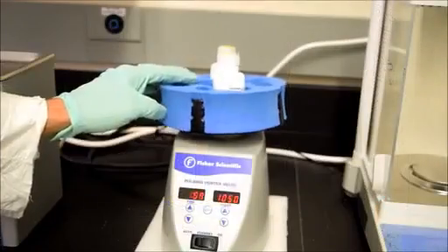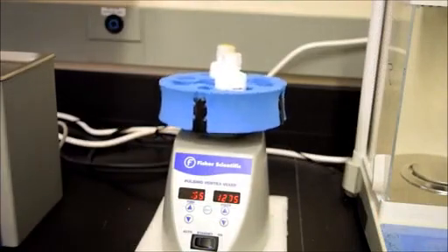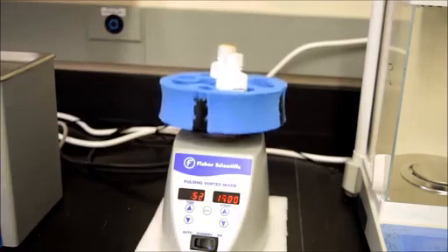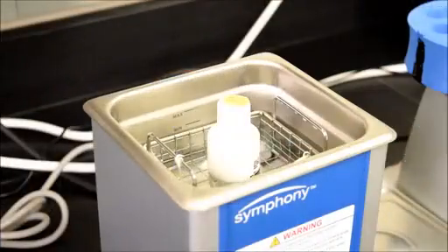To help ensure a uniform solution, briefly vortex mix the solution for one minute. Then, sonicate the solution for one minute.